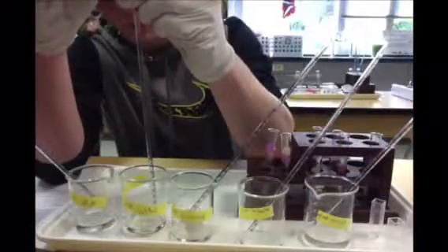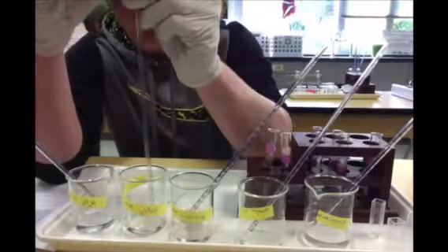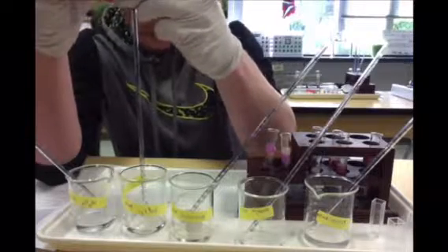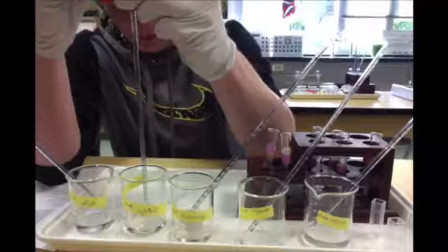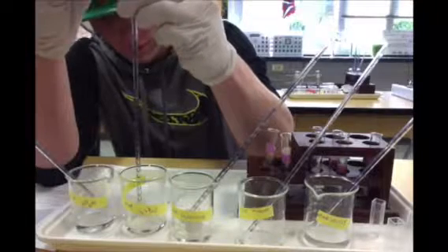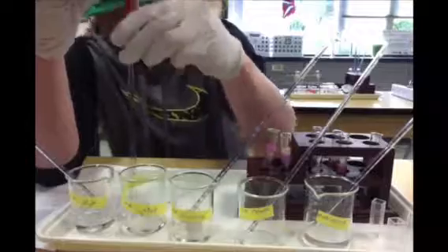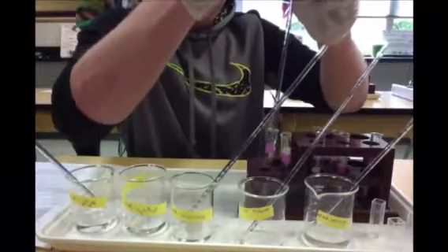When filling the pipette with solution, you want to be at eye level. And we're putting in 4 milliliters of this pH 5 buffer. So because this is only a 2 milliliter pipette, I'm going to put all 2 milliliters in here. And from there I'm going to proceed to put it in my blank solution test tube.